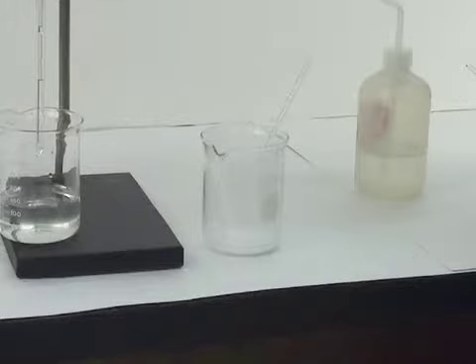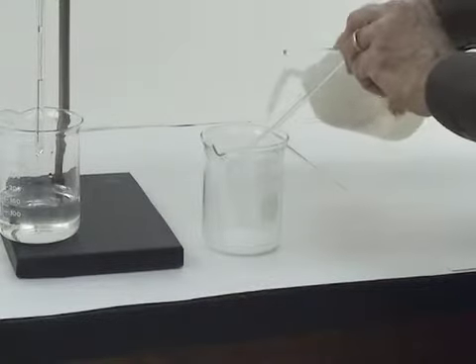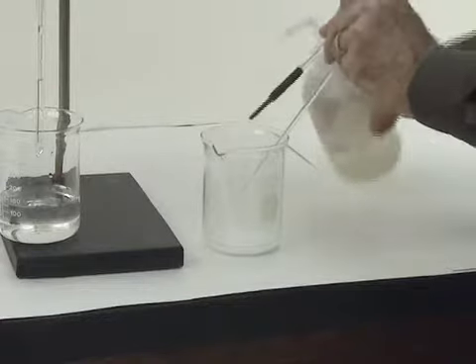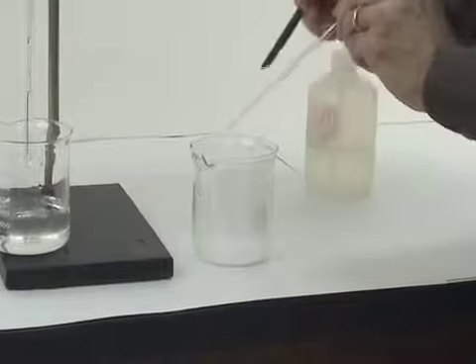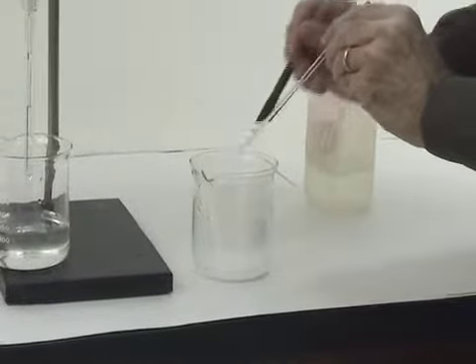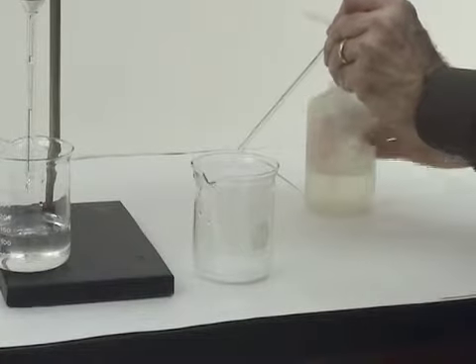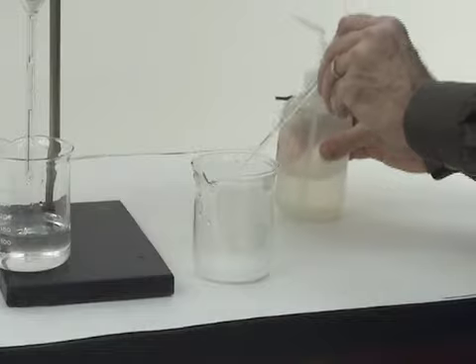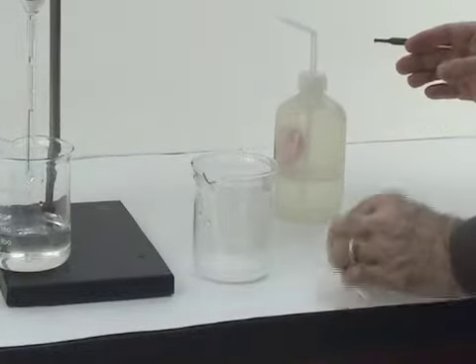After decanting, we'll have a little bit of liquid and all of the solid in our beaker. Now it's time to clean all the precipitate off of our stirring rod. We do that with the aid of our wash bottle of deionized water and the rubber policeman. Wet the rubber policeman with deionized water, then use it to scrape down the stirring rod. Rinse the stirring rod now that the precipitate has been loosened up. Get all the precipitate into the bottom of the beaker.